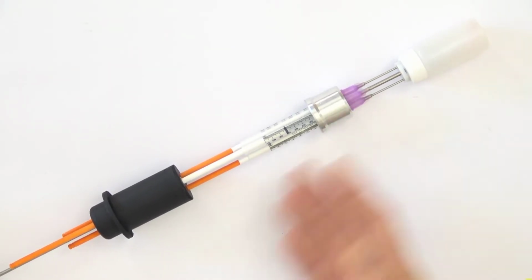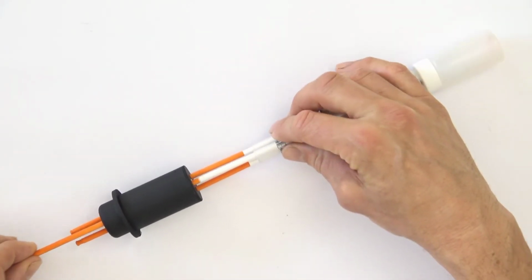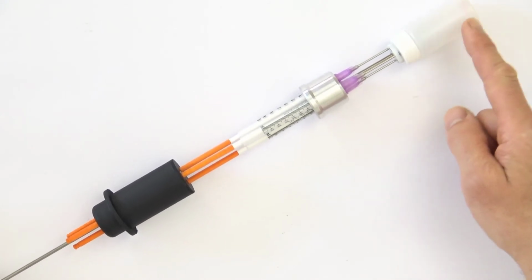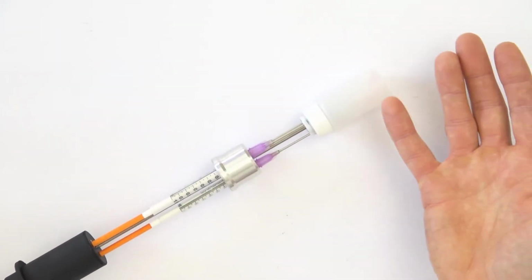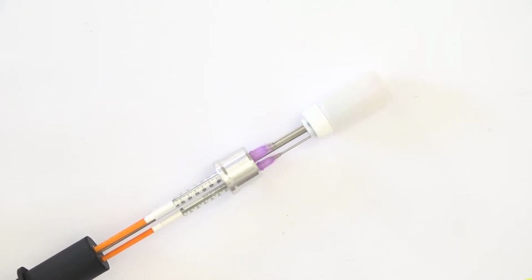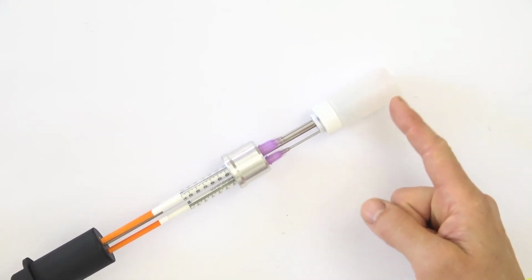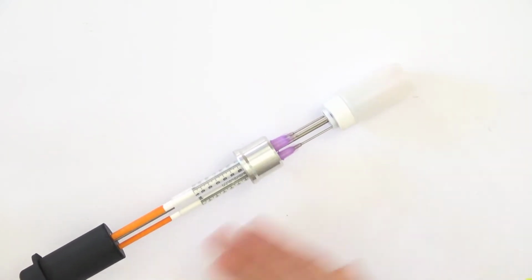When we have this in the calorimeter with a constant temperature, we can inject the water like that with a syringe and mix the sample, because we have a mixing motor here and the shaft. So there is a mixer inside the vessel or inside the vial. So we can start the measurement in the calorimeter. This is a good way. And it minimizes the disturbances, but it's not free from problems because there is mixing energy, friction and other things down here. So there will be disturbances also, but this is at least a way to avoid the initial disturbance caused by the sample having the temperature of the room when you charge it.